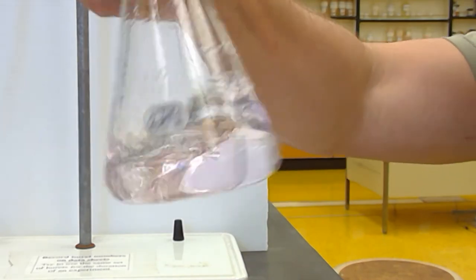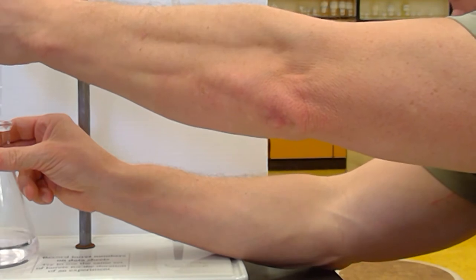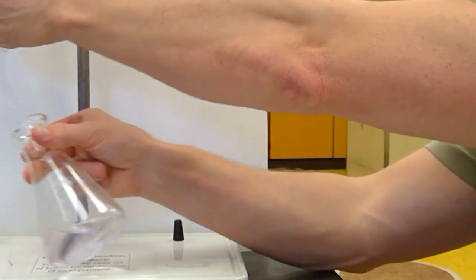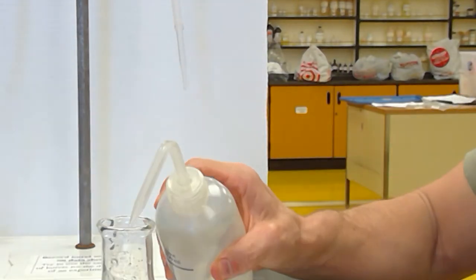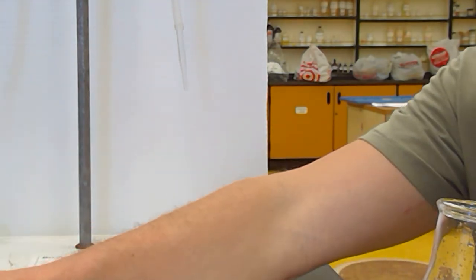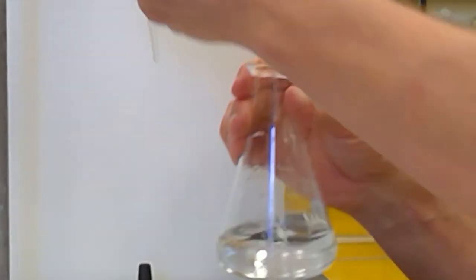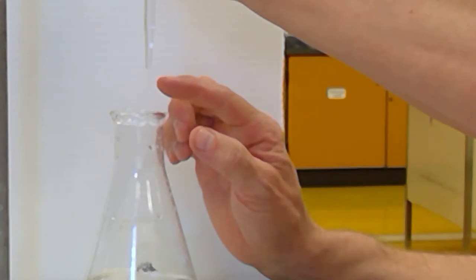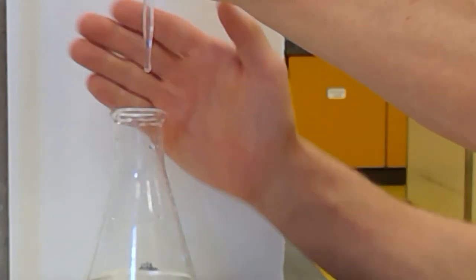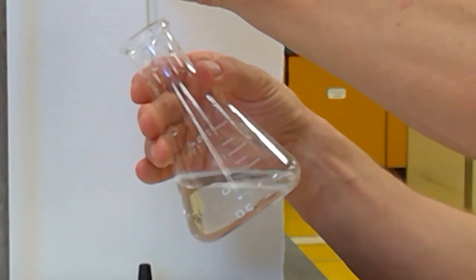Yeah, it's pretty faint, but I can still see it's pink. So let's add another drop of the back titrant. Get that colorless again. So that'll be my third. Usually within three back titrations, sometimes four, I will nail this. Let's see if we can get even closer here. So I'm just going to get this tiny, tiny partial drop. There's just a little partial drop hanging off there. Can you see that partial drop? I'm going to tap that off on the inside neck of the flask.